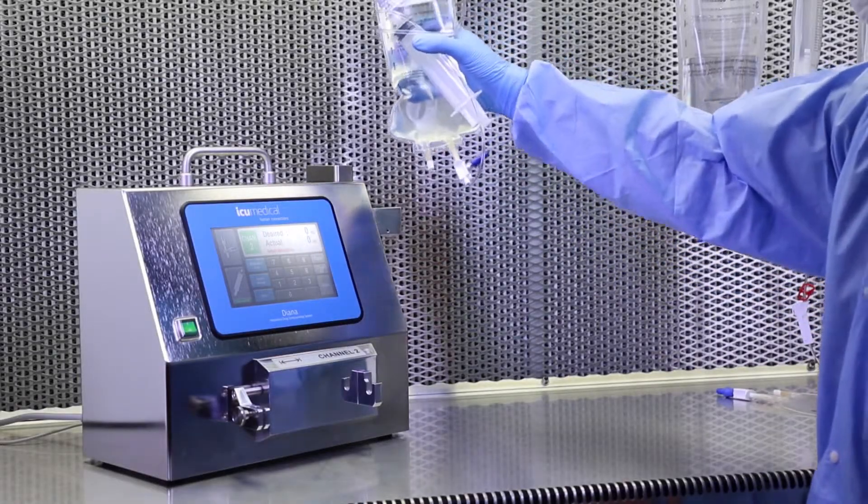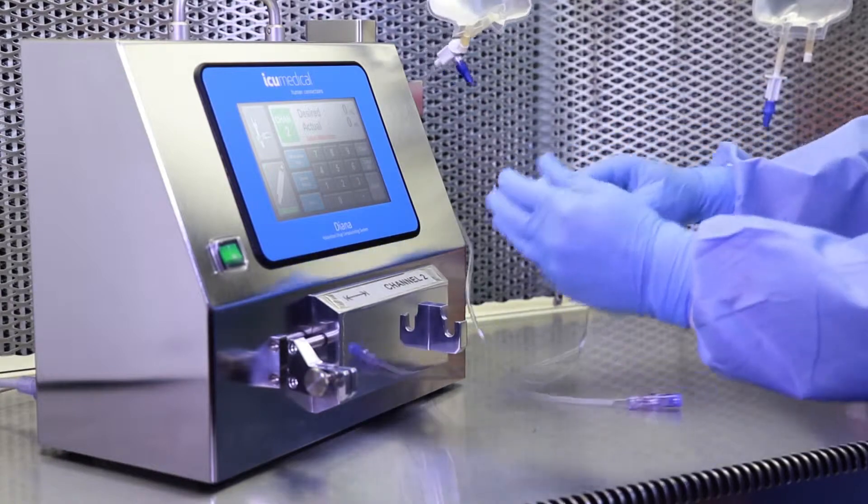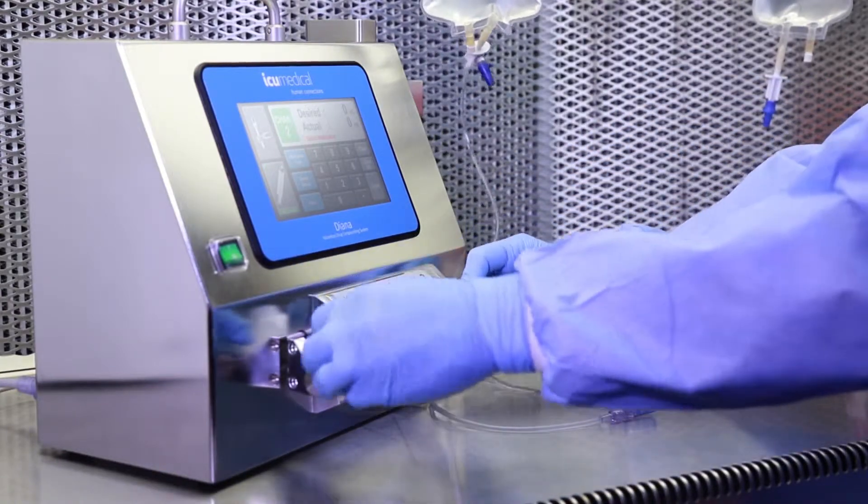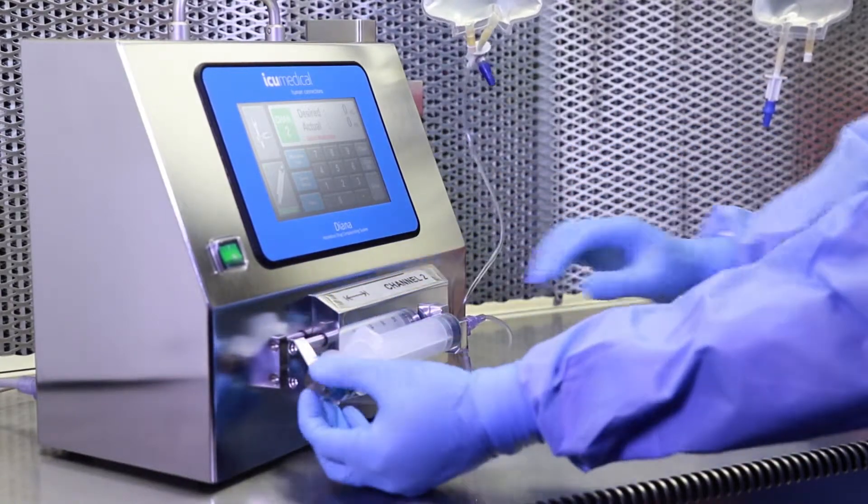That way, when you receive a patient order, simply connect the same stock bag to Diana and safely transfer a desired volume of drug into an administration bag.